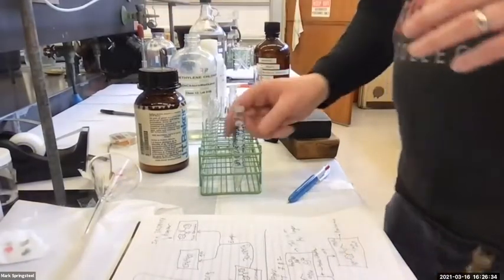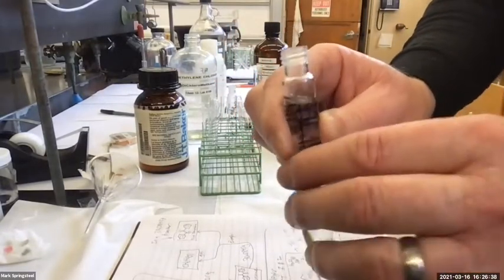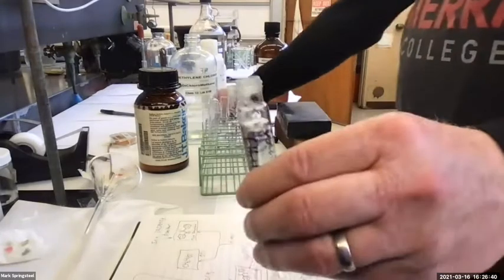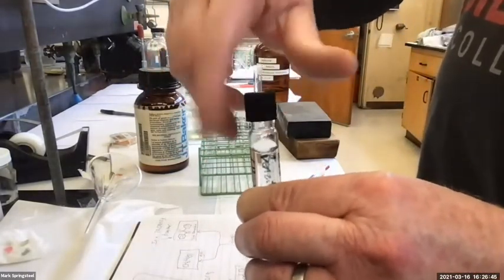Add a few squirts of methylene chloride to this, and it's going to dissolve that benzocaine. We can't see it. Oh, can you not see it right now? No. How about now? Does that look better? Yes. So I've added methylene chloride. It's down on the bottom. And I didn't give myself a lot of headspace. This is a little more full than I like, but that's okay. It'll work. I'll be careful with it.